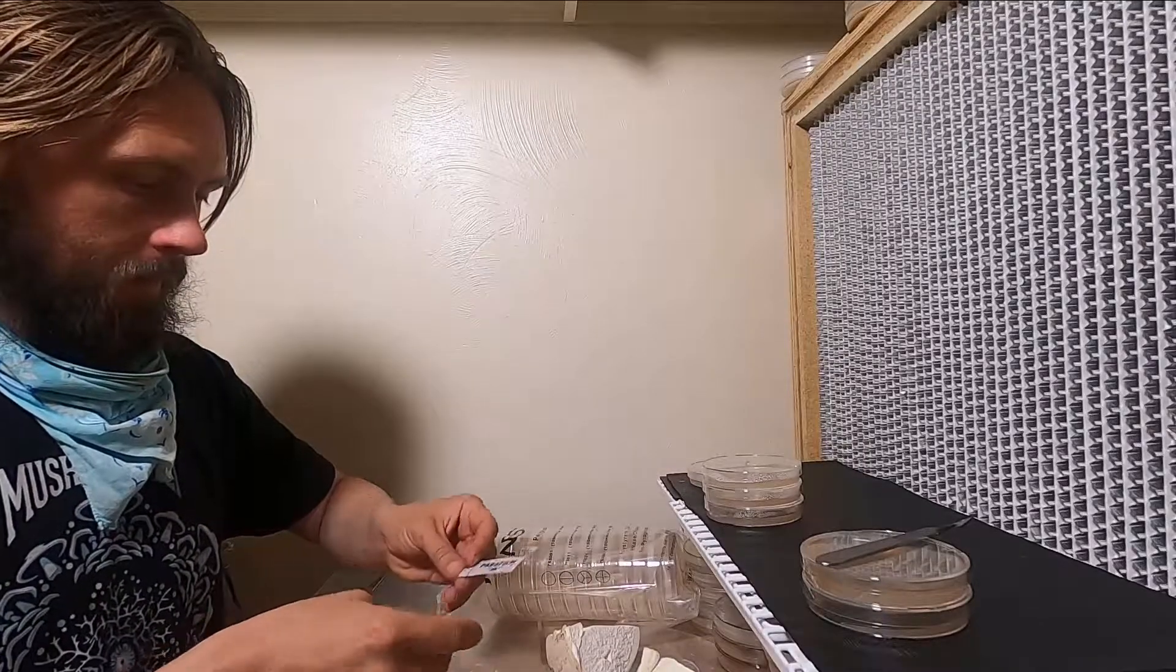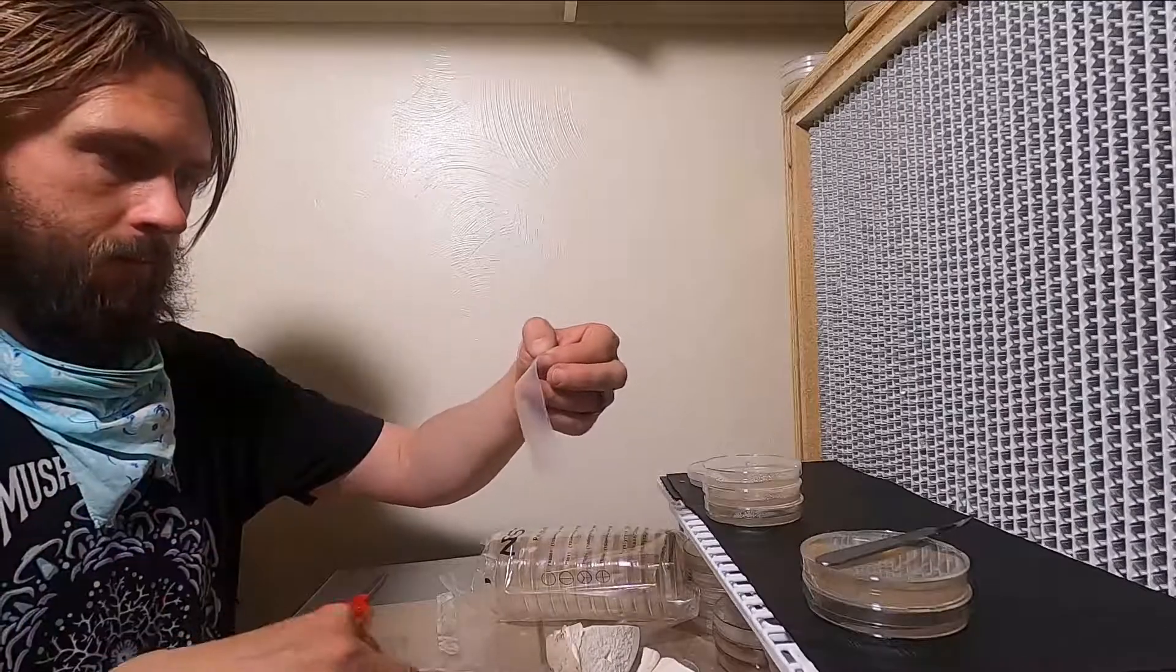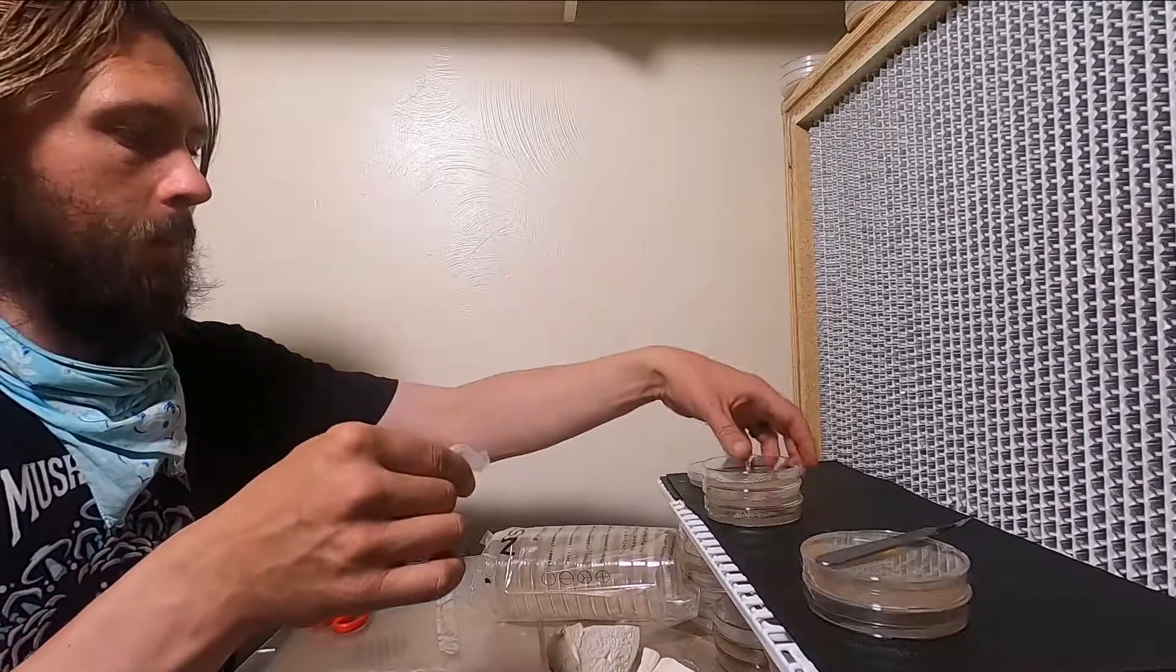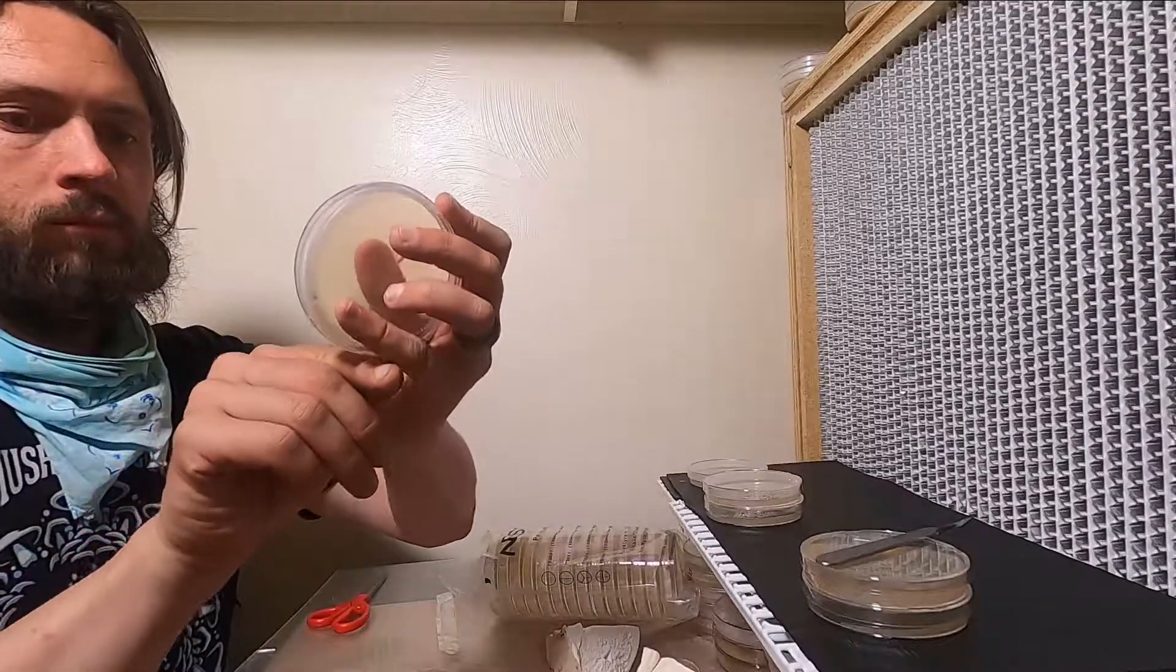This is my cloning procedure for really any mushroom. Some mushrooms will not grow on malt extract or potato dextrose agar. This is malt extract agar. It's a very simple recipe.